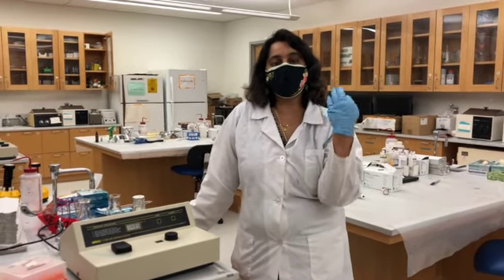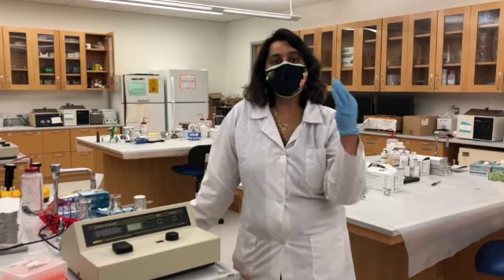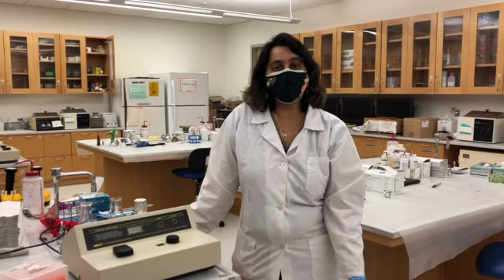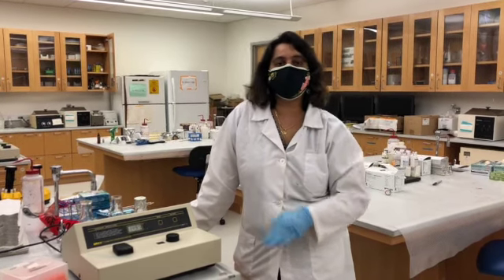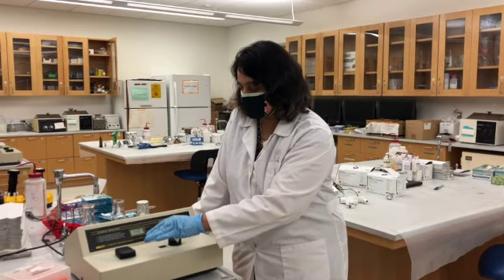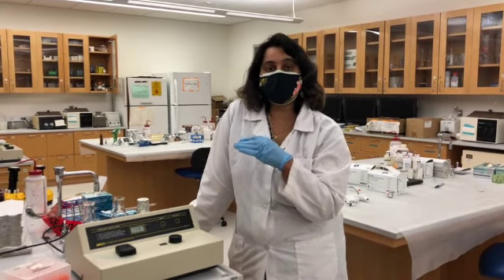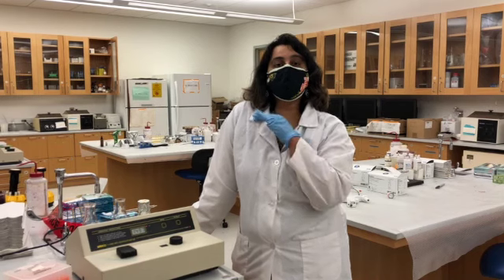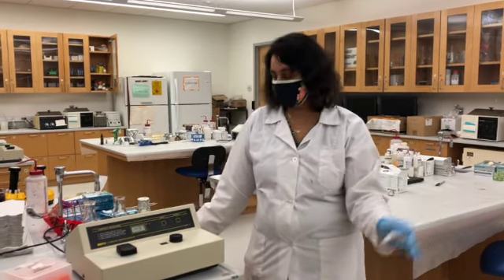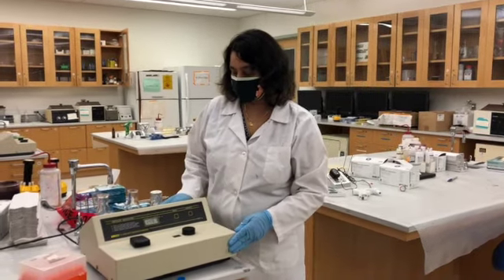Whenever you're planning your microbiology diagnostic experiments, you want the bacterial cultures to be in the late exponential phase or early stationary phase. So that's when you can do all your diagnostic tests. So this absorbance value represents that the bacteria is at a very good growth stage, and you can stop the growth of the bacteria and do your diagnostic tests. Okay, so this is about the spectrophotometer.